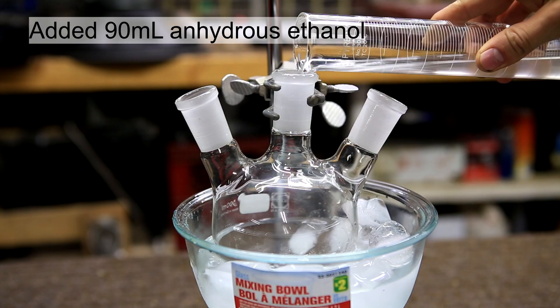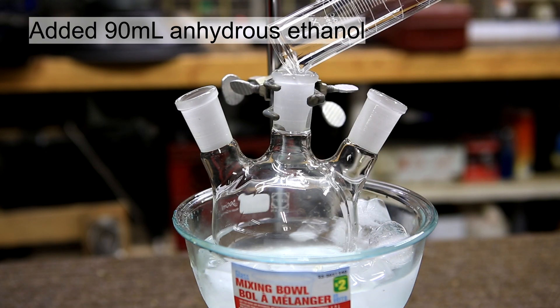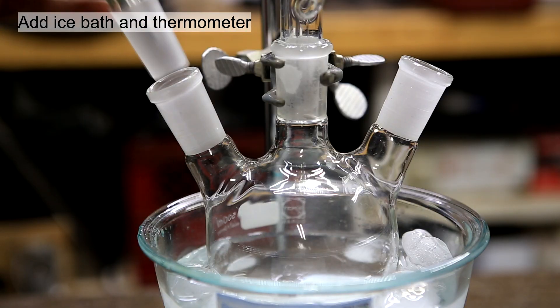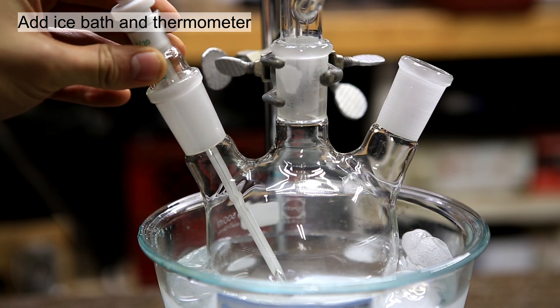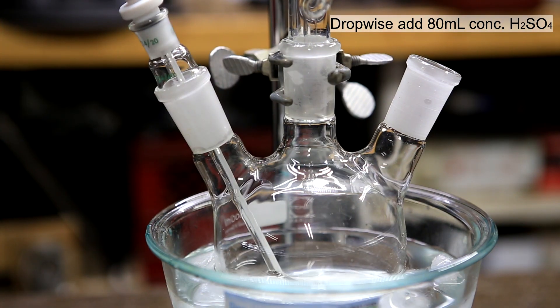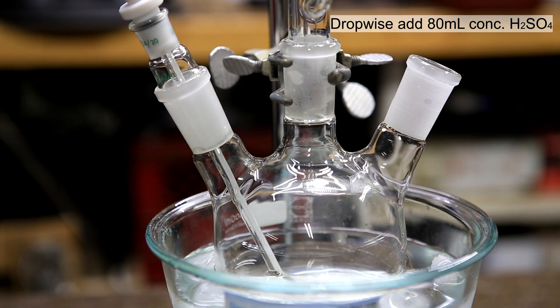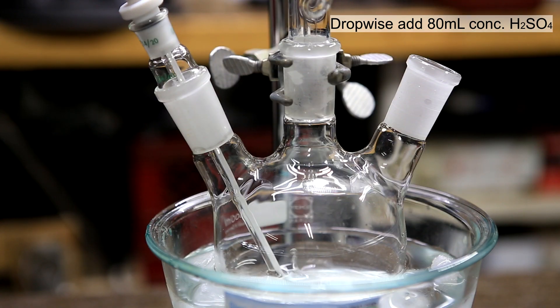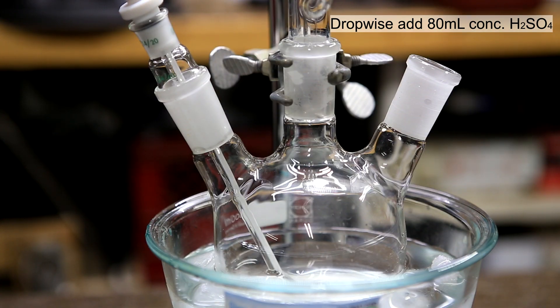90 ml of anhydrous ethanol is added to a three-necked round bottom flask in an ice bath. A thermometer was added and the ethanol was allowed to sit in the ice bath to cool until about 5 degrees Celsius. Using an addition funnel, 80 ml of concentrated sulfuric acid was added drop-wise slowly. The entire addition took about 15 minutes.